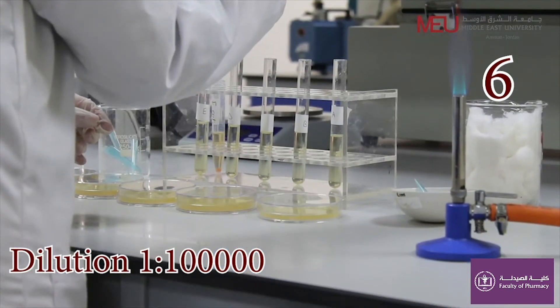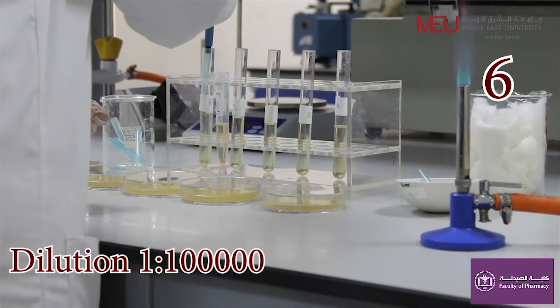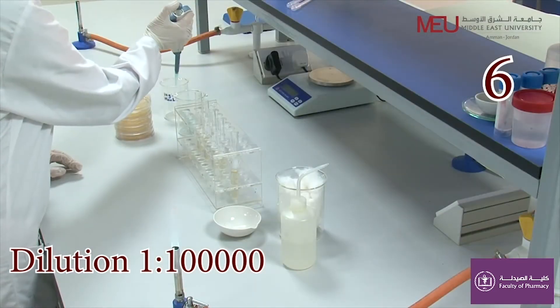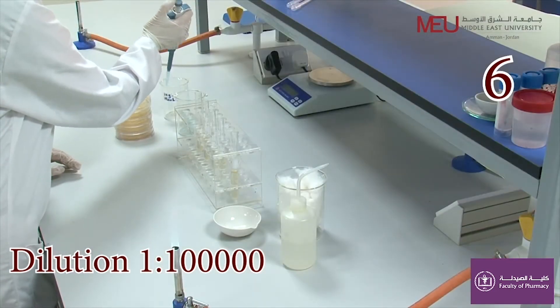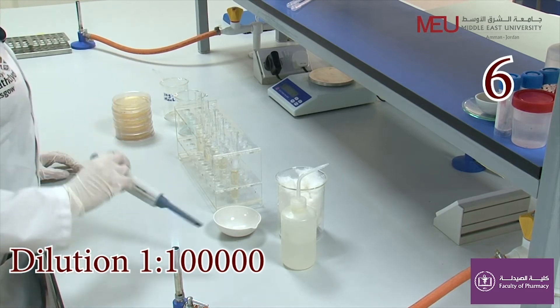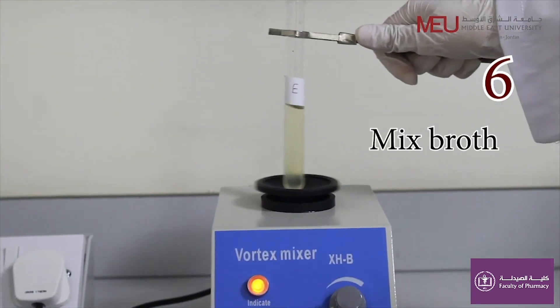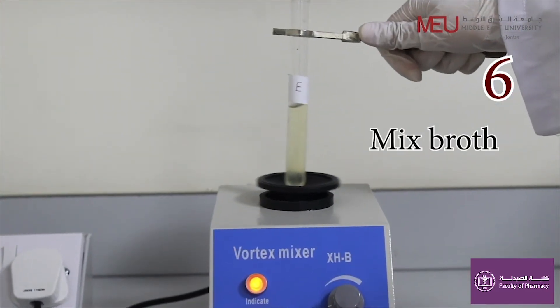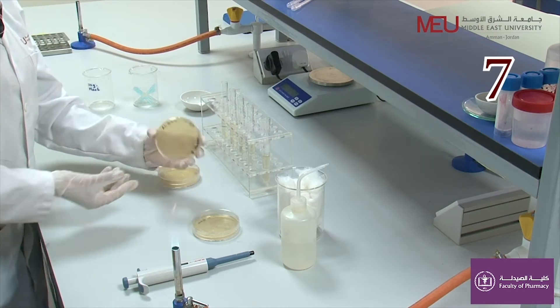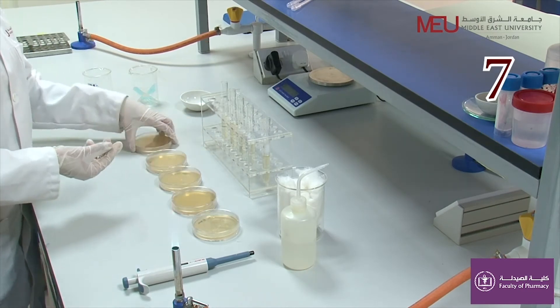Remember to discard 1 ml from the final test tube. Label 5 agar plates with your name, date, and test tube number.